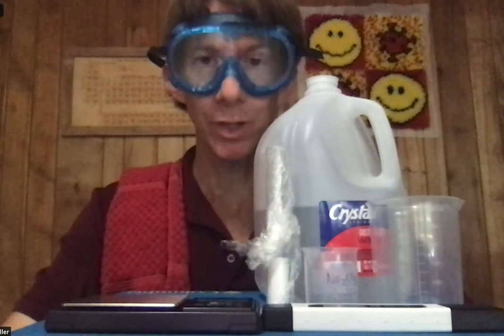Experiment six: calorimetry. I've got almost all the materials I need right here. There are a couple of materials that are missing — one is the coins, 50 grams of coins, which are already in the freezer because I'm going to run the experiment in a little bit and wanted to prep. The ice cube is also in the freezer as well.